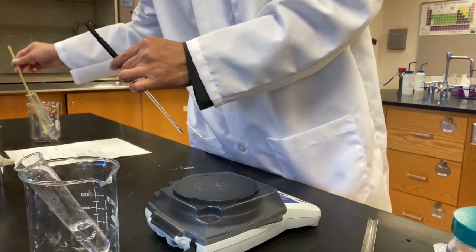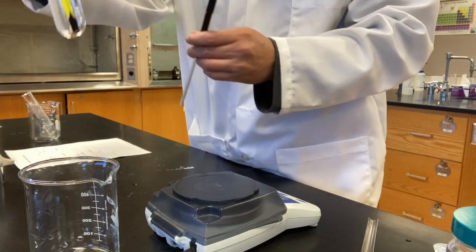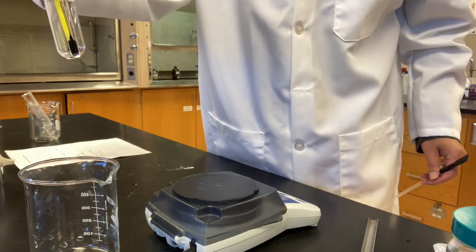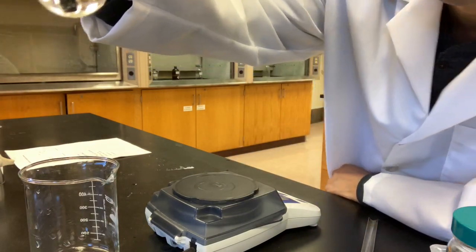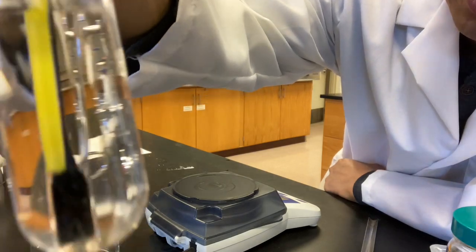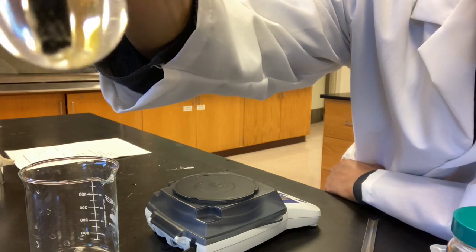And I'm going to put a thermometer in here. I'm going to observe it when the first crystal is coming out from it. When the first crystal is coming out, I'm going to take a record of the temperature to see at what temperature the first crystal will come out. Look at that. I don't know if you can see the crystals, but at the bottom of the thermometer, there are some tiny crystals coming out. I hope you can see it.